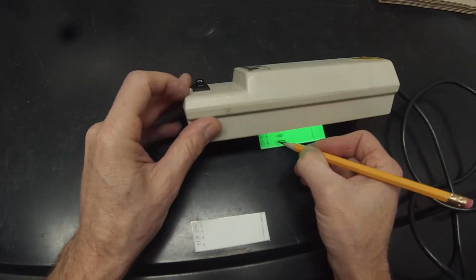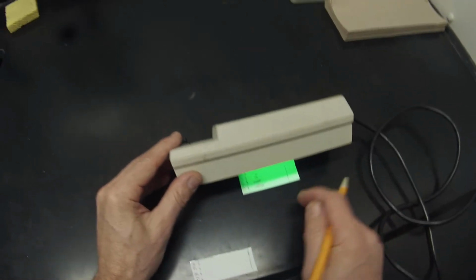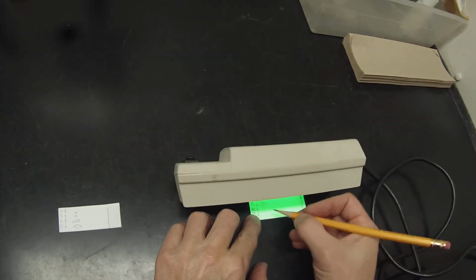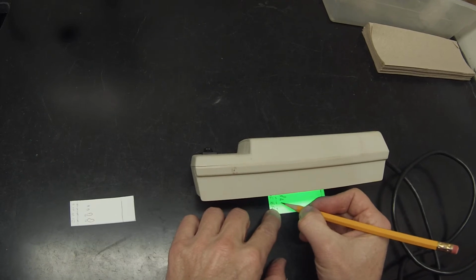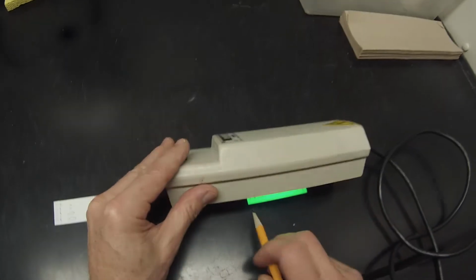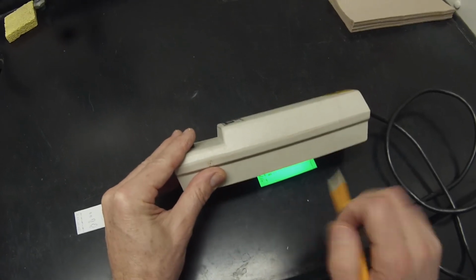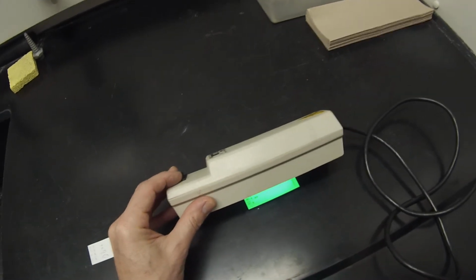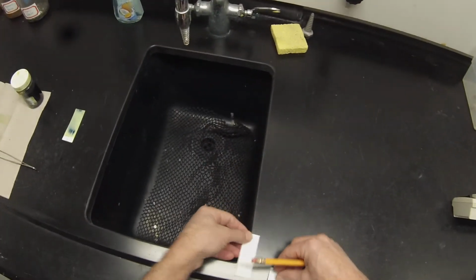The 9, 10, 11, 12 we're going to take. It looks like this bottom spot here, which could be the other alcohol, could be the ketone, is present in those guys. And then on 14, that's probably our alcohol. But like I said, it looks like we probably don't want these fractions. 14, 15, and 16 definitely have some stuff, but probably not much product. 17 is blank, so I can get rid of 17. It may show up under the phosphomolybdic acid staining. So the biphenyl was off by fraction 8, that impurity.